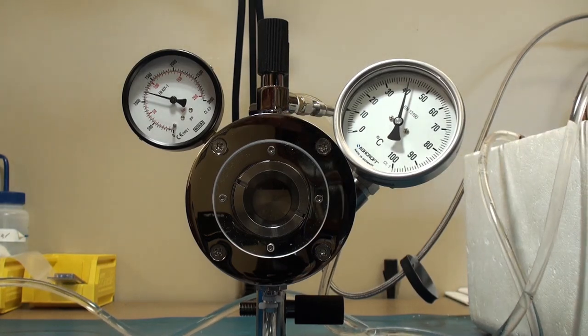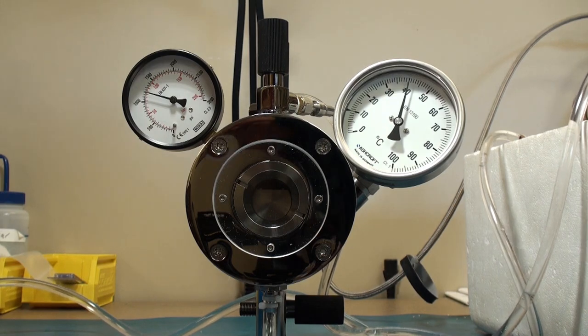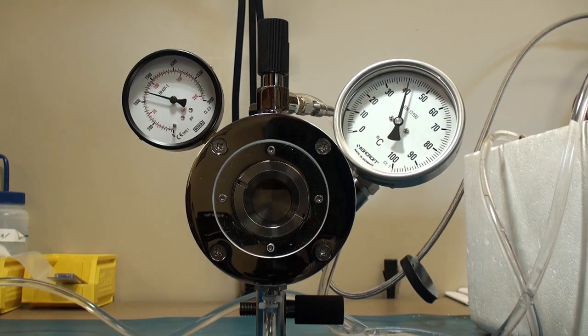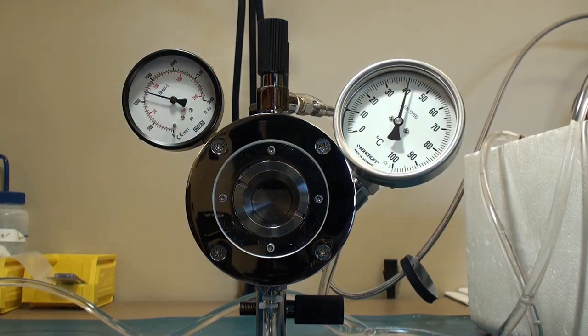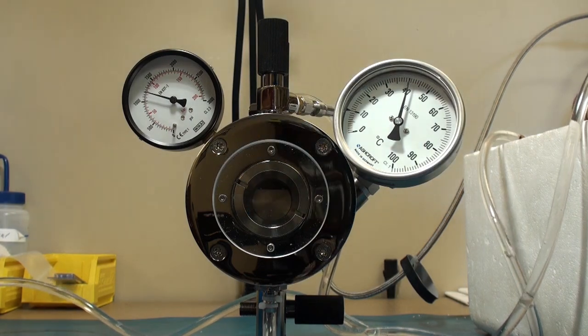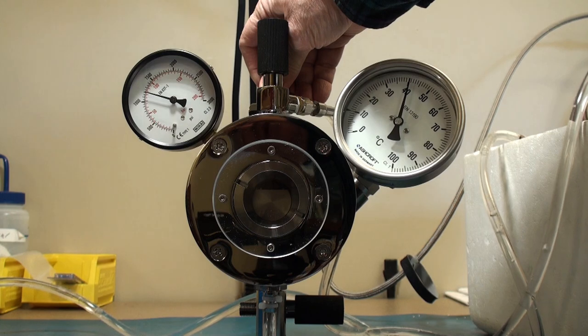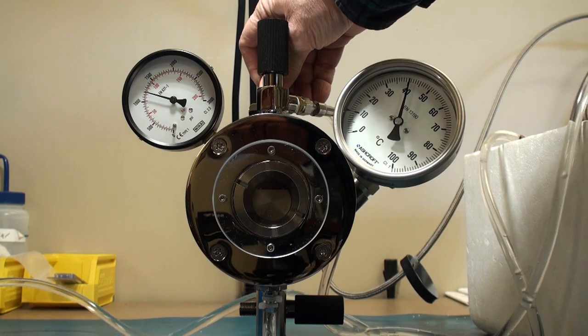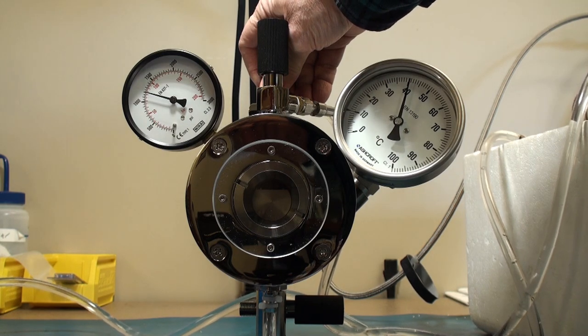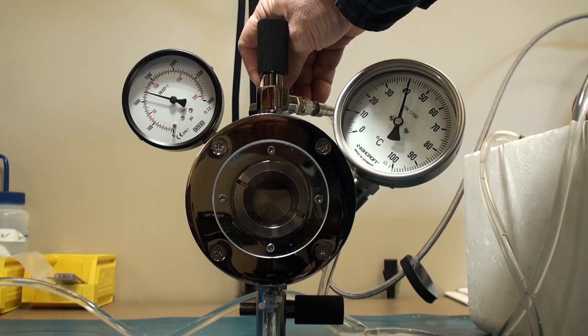You can see the temperature is still about 40 Celsius, well above the critical temperature of 31.5 Celsius. So right now we're on perfect track for having some nicely critical point dried samples. So we will come back when we're closer to being able to open the device.